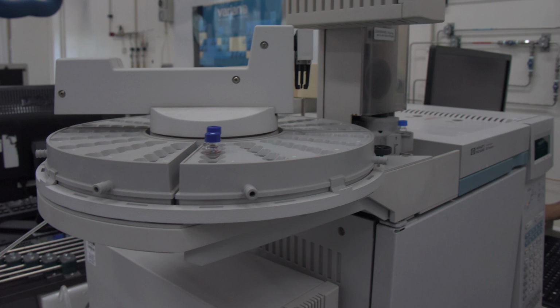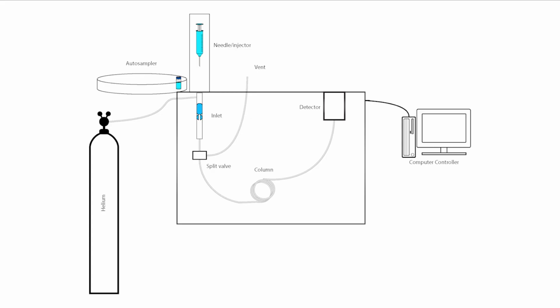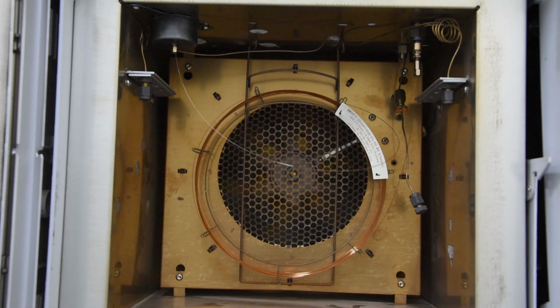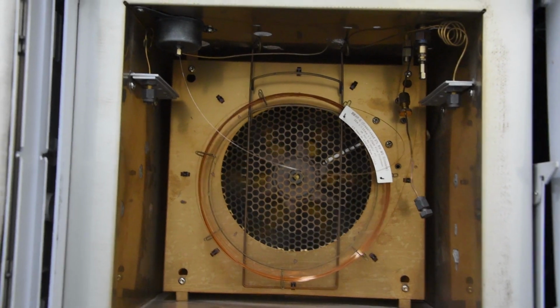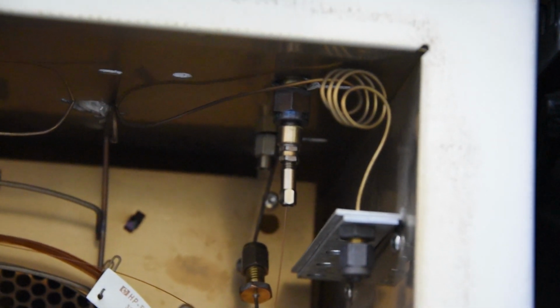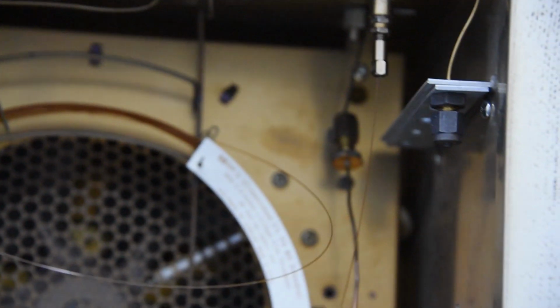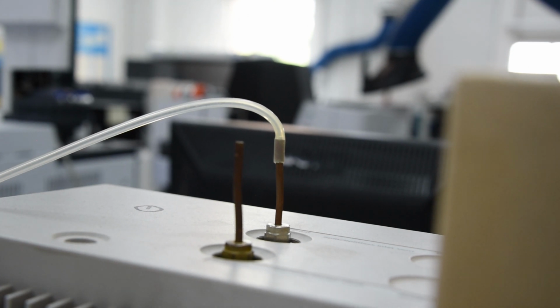On the GC instrument, the sample carousel, autosampler, needle, and oven can easily be seen from the outside of the instrument. The inlet, split valve, column, and detector are hidden more deeply inside the instrument. GC operates similarly to other forms of chromatography where there is a stationary and mobile phase which facilitates the separation of analytes. In the case of GC, the sample is volatilized in the inlet and swept through the instrument by a flow of gas. The sample is split, so only part of the sample makes its way onto the column, and most of the sample makes its way into the vent.